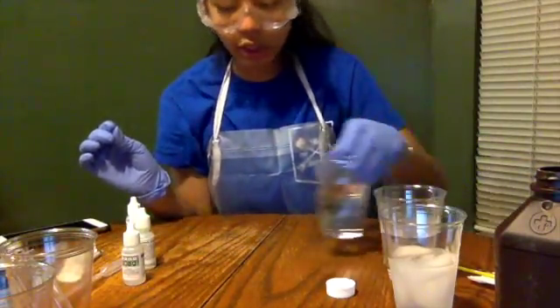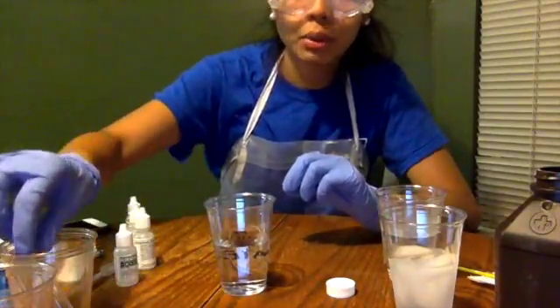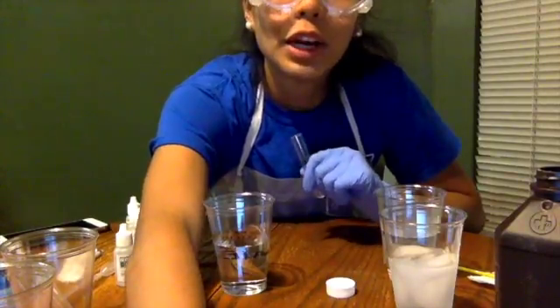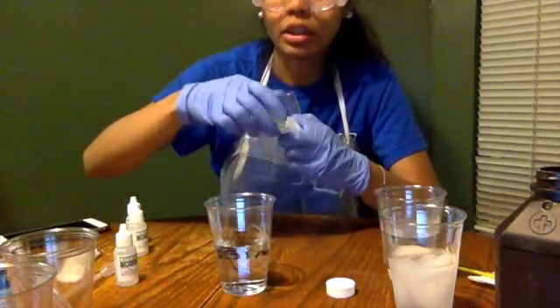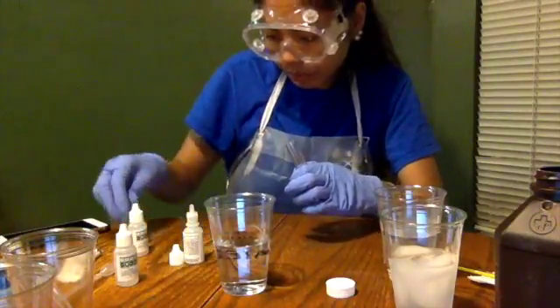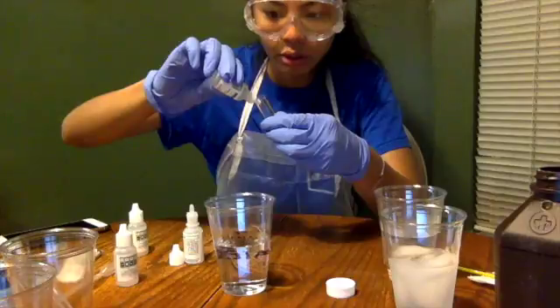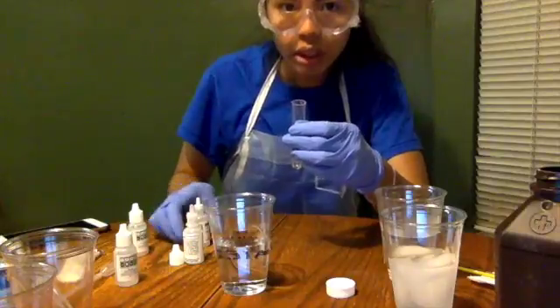And we're going to test the room water. And what I'm going to do, we're going to take the measurements from activity 2 to test this. So we're going to take 8 drops of potassium iodide. 8 drops. So we can do 1, 2, 3, 4, 6, 7, 8.